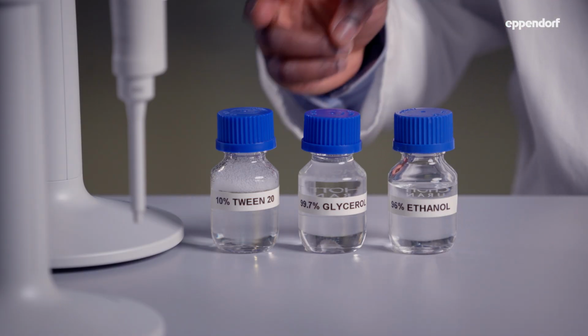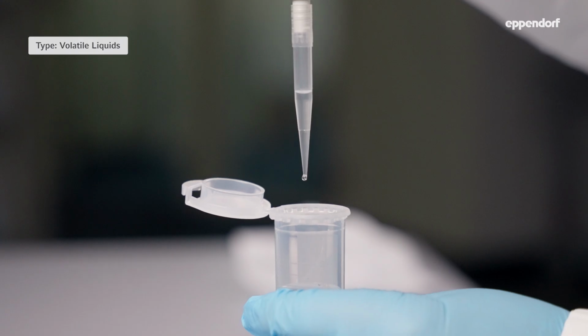We'll be using an Eppendorf Explorer pipette and a Multipette E3x multi-dispenser to show you how to deal with volatile, viscous and foaming samples. Let's talk about volatile liquids first. Have you ever had liquid drip out of the pipette tip as soon as you pull it out of the sample?